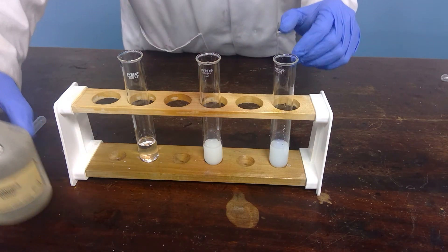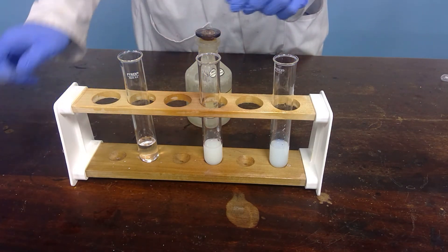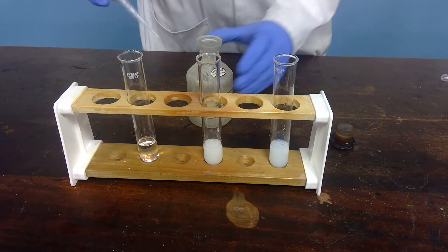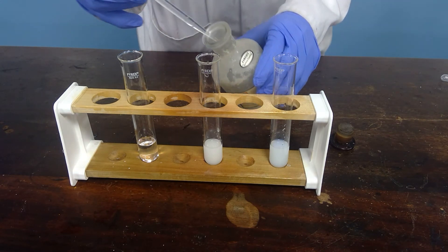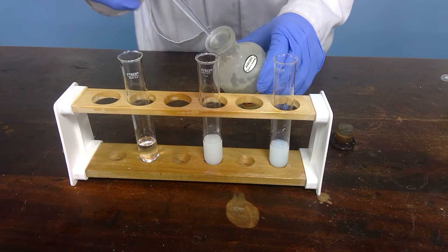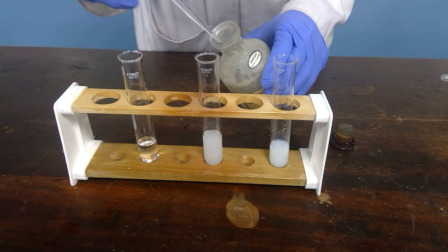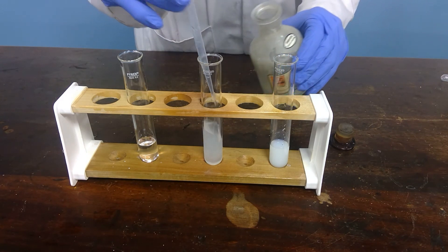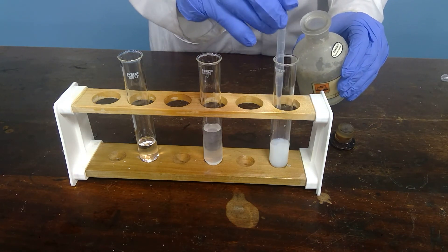So you will then use the concentrated ammonia. We don't need to use it on the chloride, because of course that has already dissolved. An increase in concentration of the ammonia will make no difference there. So let's first try the bromide — I'll add some concentrated ammonia to this one. And we'll add some concentrated ammonia to the silver iodide.